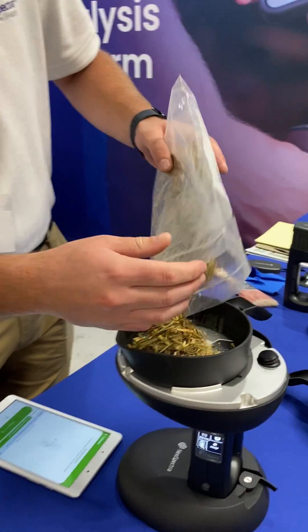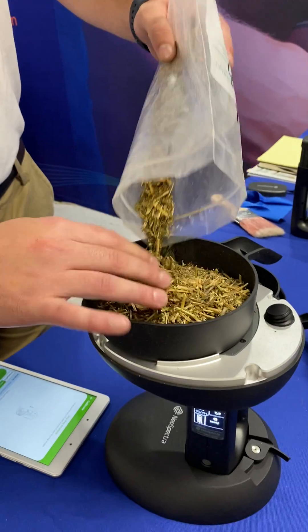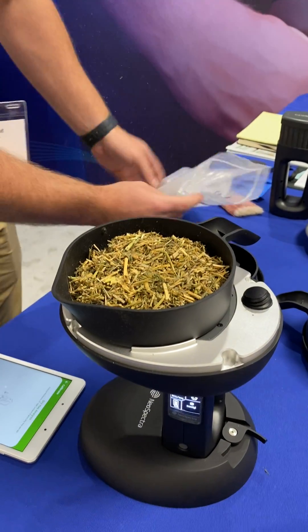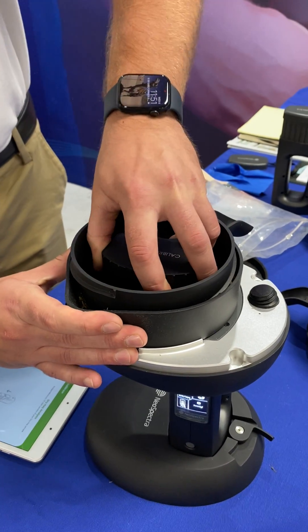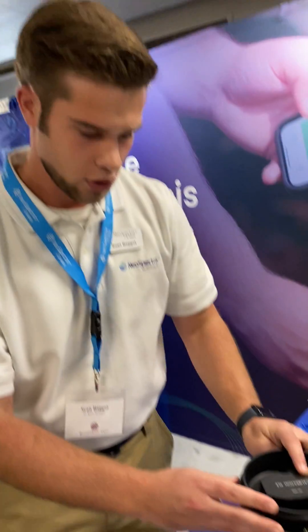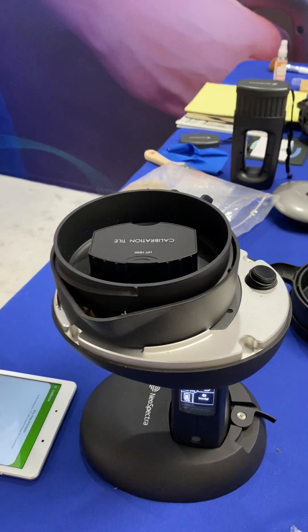What we'll do is pour our alfalfa hay, and then compress that sample down with our lid and make sure it's finger tight. I'm going to check the bottom to make sure there are no big leaves that will interfere with our scan.